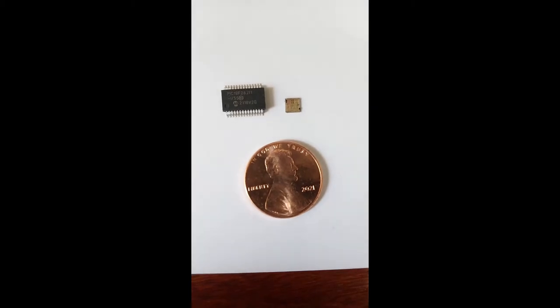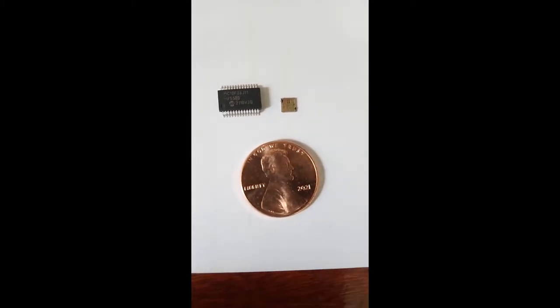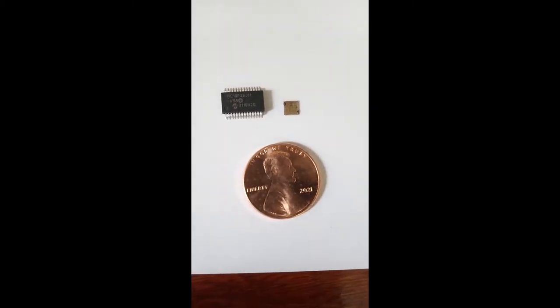Today we will be looking at the die I pulled out of a PIC microchip. It's a PIC18F26J11.